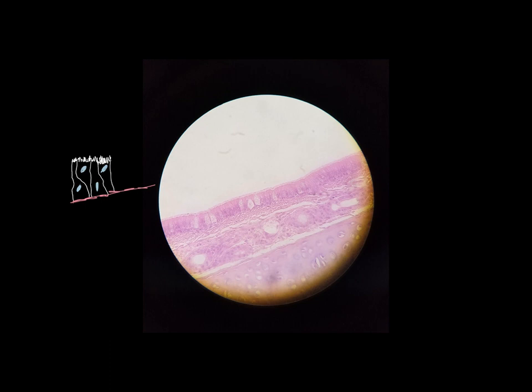multiple layers. So if we look at this slide here, there's actually several tissues. What we're concerned with is this top area right here. This is our pseudostratified columnar epithelium. And if you look at it, it looks like it's actually several layers thick. When we look right here, you can see there's a nucleus, and there's a nucleus, and there's a nucleus, and there's a nucleus. So it looks like there's a couple of layers there at least. But if you look really, really closely, what we're actually seeing, if we look over here at this drawing that I have on the left, it's one layer.